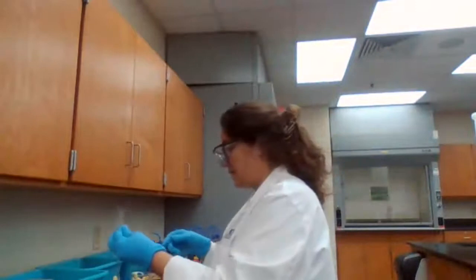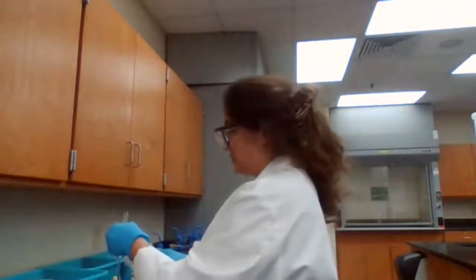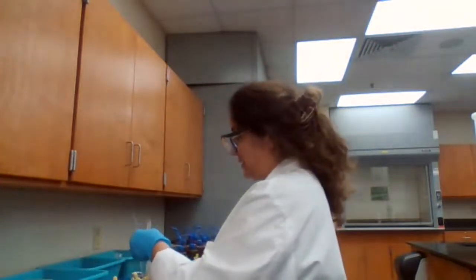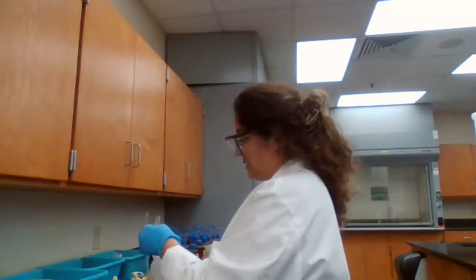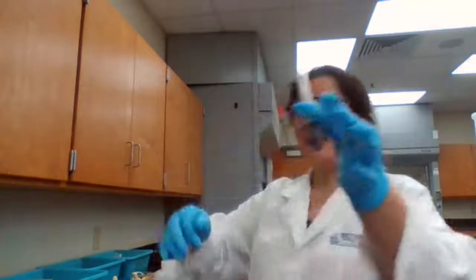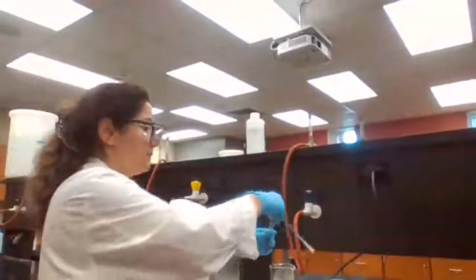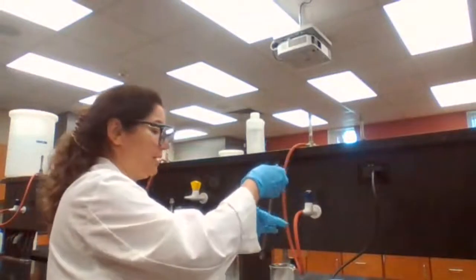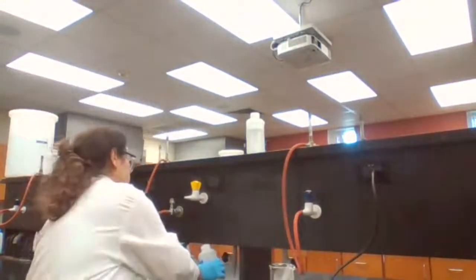And we want to make sure that we stir it with the clean stirring rod. It tells me to stir it with the clean stirring rod and heat it up until it is dissolved. So I add the HNO3, placing in hot water bath, and stirring until it is dissolved. Wash it again. So make sure.